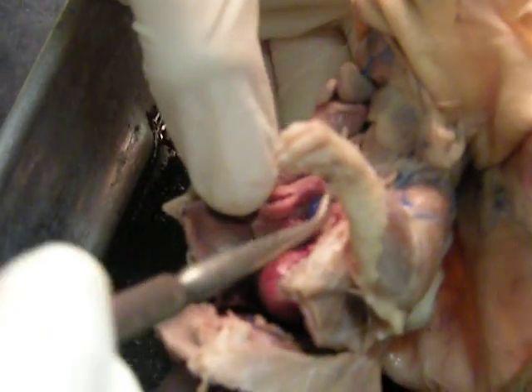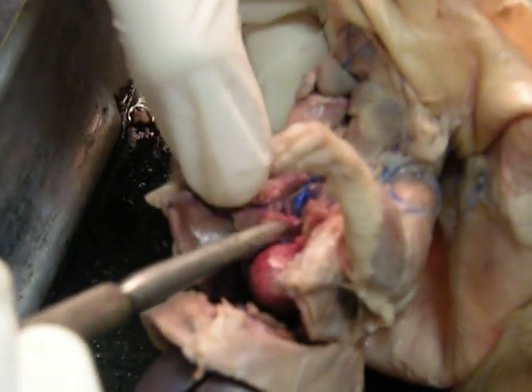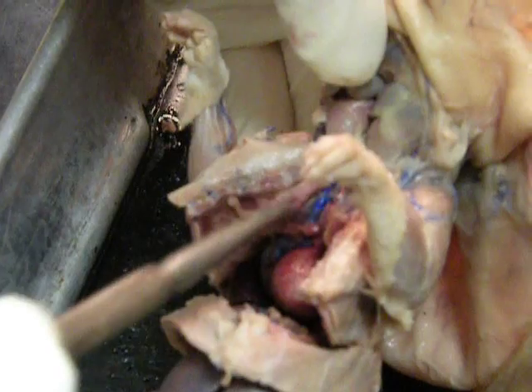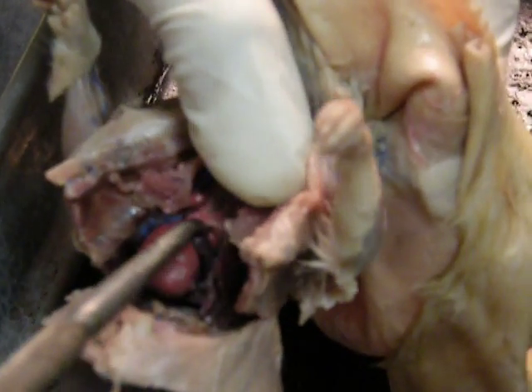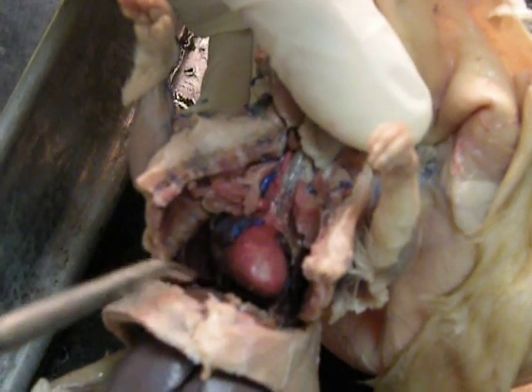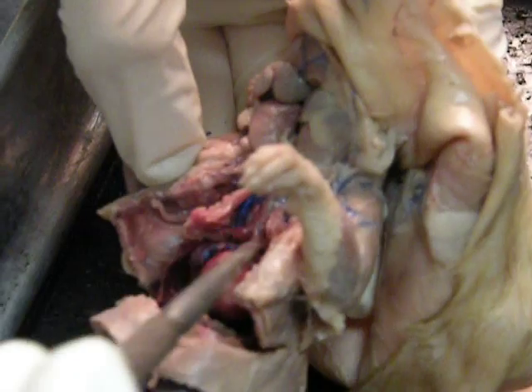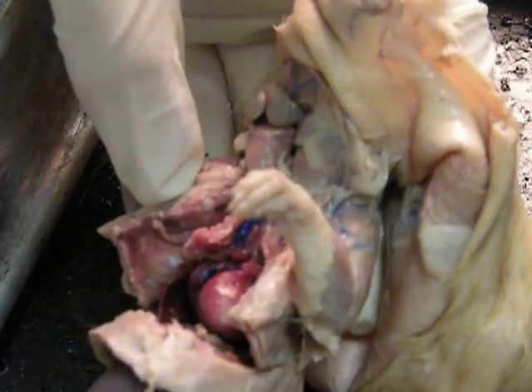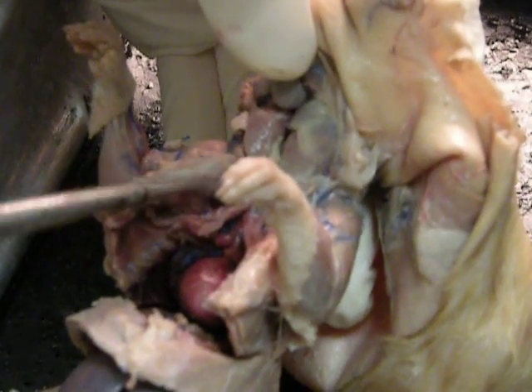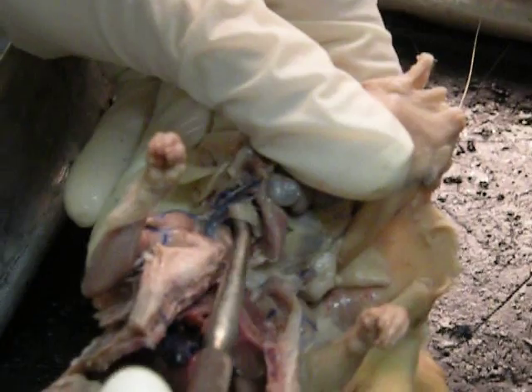Now, in rats, it's not called the superior vena cava — that's only in humans. What happens instead is you have your brachiocephalic vein from one side and another from the other side, and they come together and merge towards the back of the heart. Some people call that the superior vena cava, but we're just going to call them separately — they're brachiocephalic veins. Up here they branch off to form the jugular veins that you located earlier.